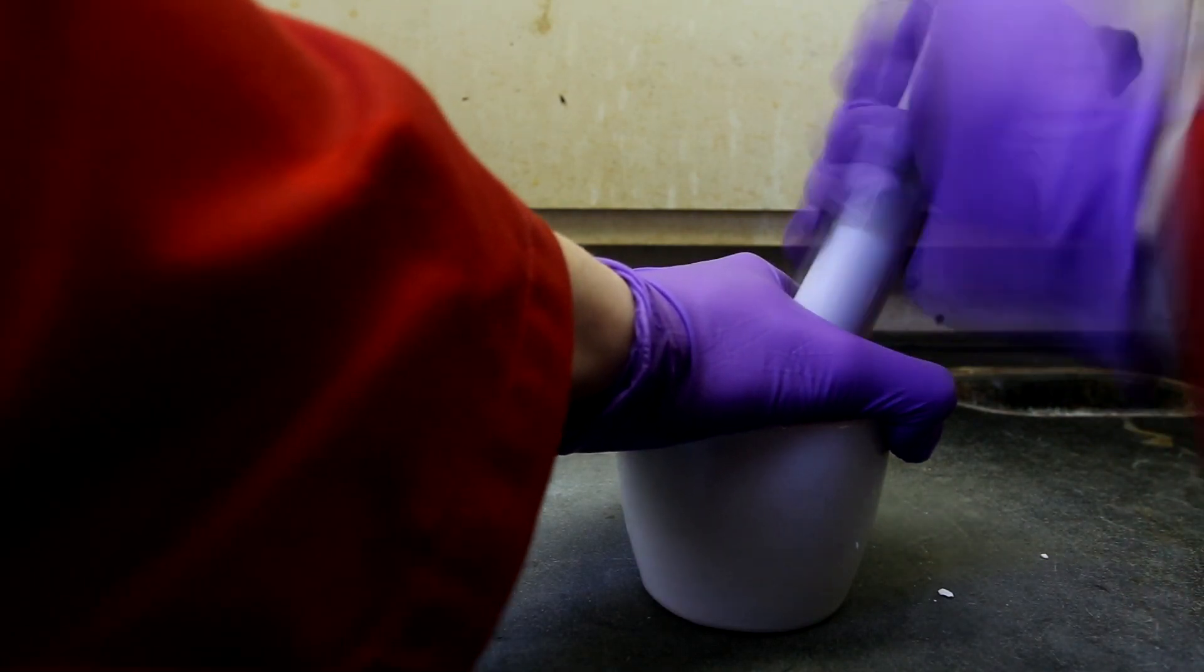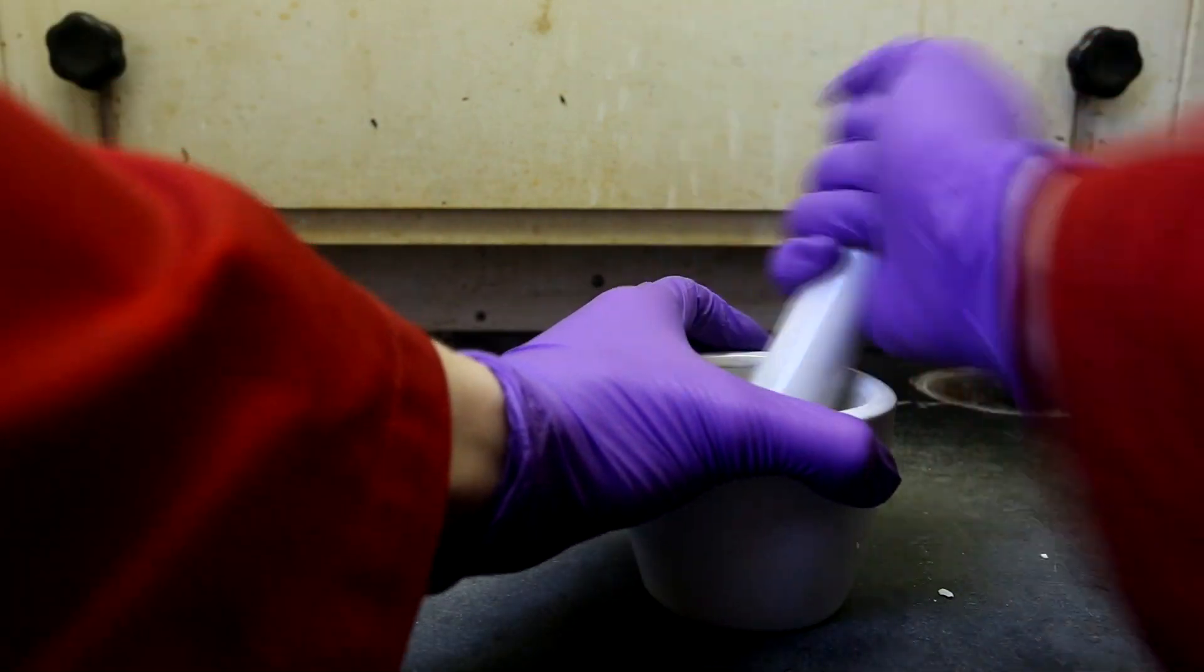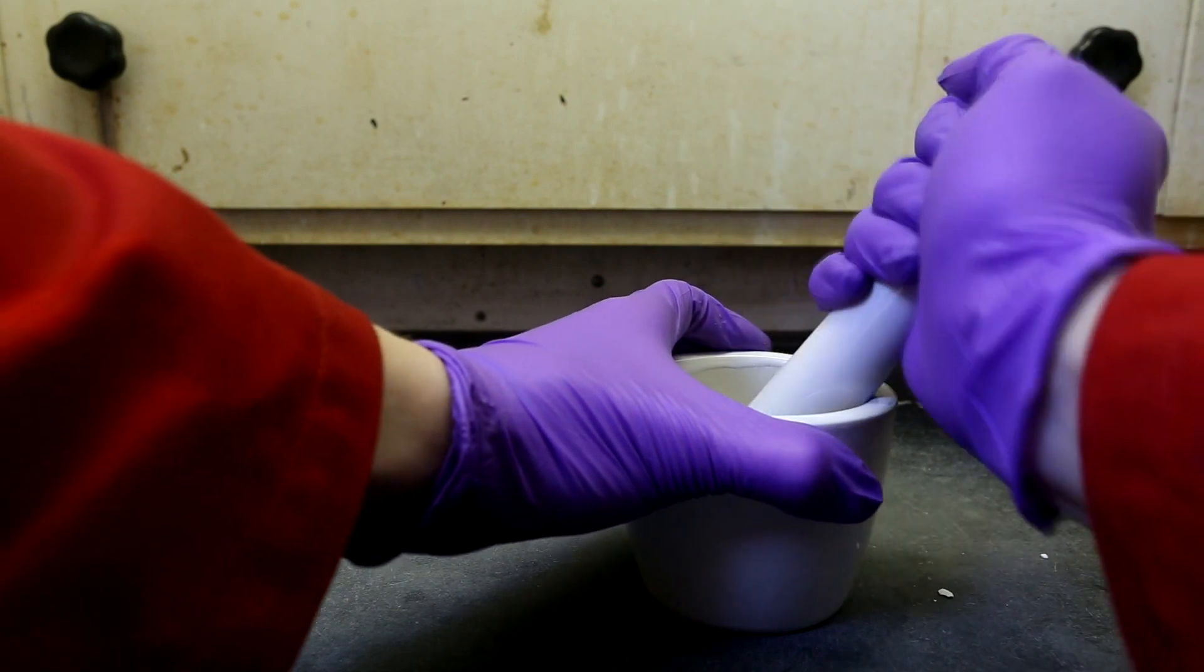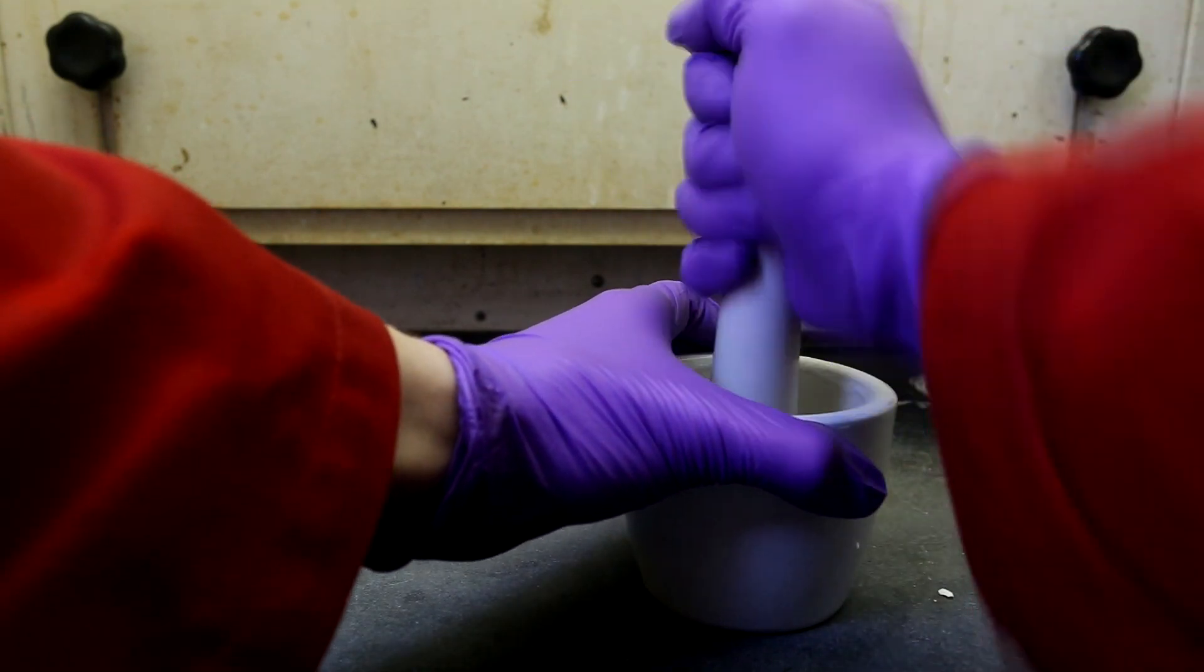Instead, I opted for a much easier method. I transferred many tablets at once to a piece of paper and then swiftly tapped each tablet with a hammer. Just one tap was enough to break each tablet into several pieces.